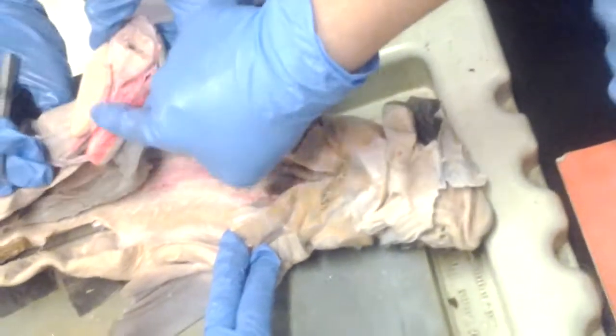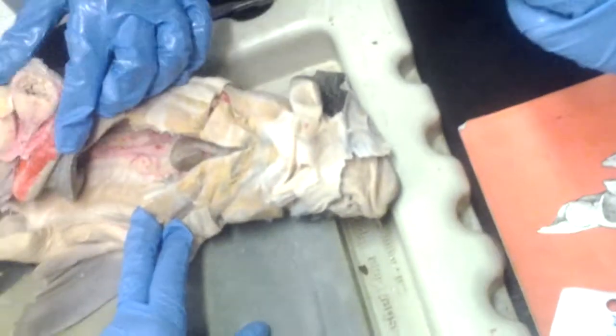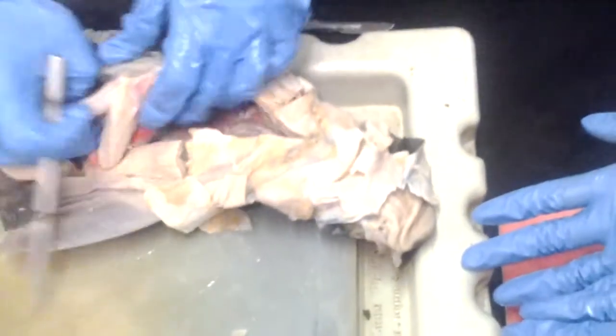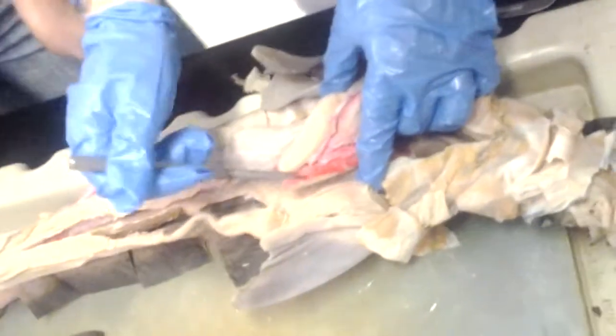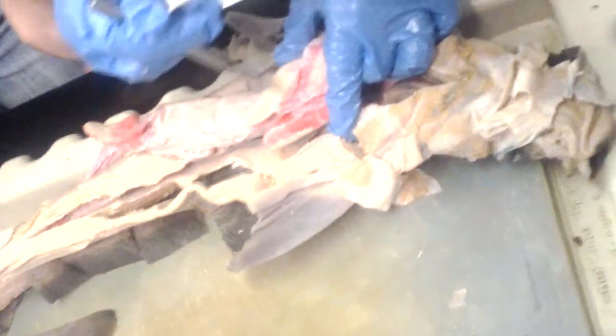What's the blood vessel to the testes? The mesentery to the testes is the mesorchium. And there was a blood vessel too, but I don't remember the name of it. Don't worry about that. We can look at that if you really want to know, but don't worry about it. So what are these? Testes. Yeah, this is the testes. Mesorchium is here.